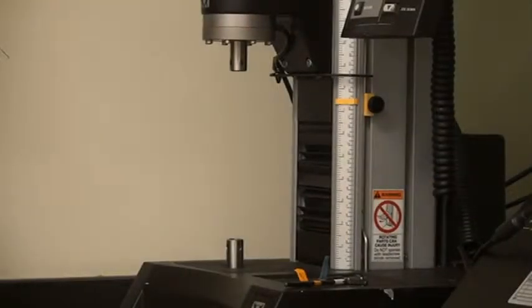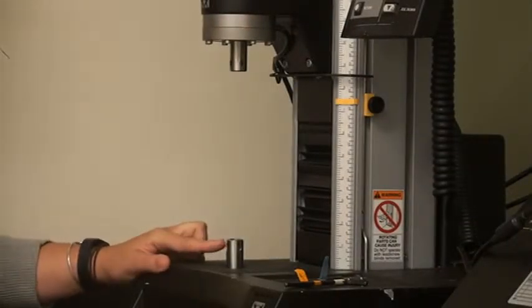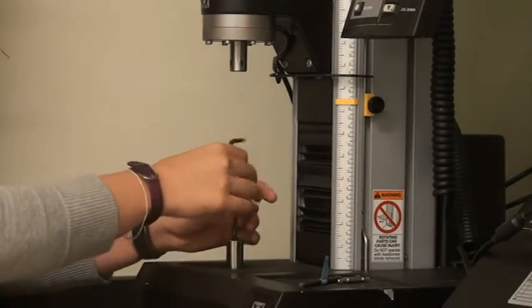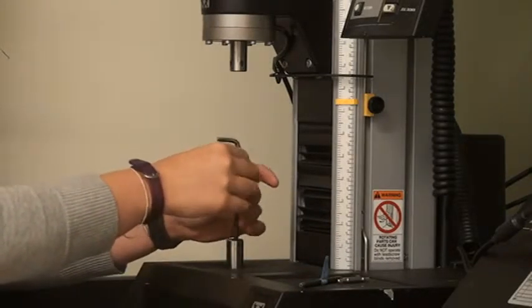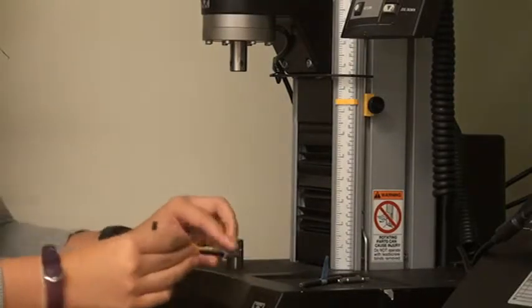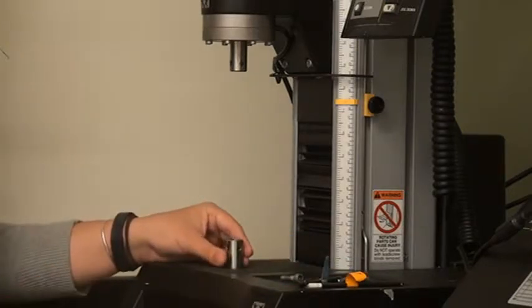To install the larger assembly, you will need to remove the lower collet. Remove the lower collet by removing the internal screw with a 3/16 inch hex key. Make sure not to spin the lower collet or you will risk damaging the internal alignment pins.